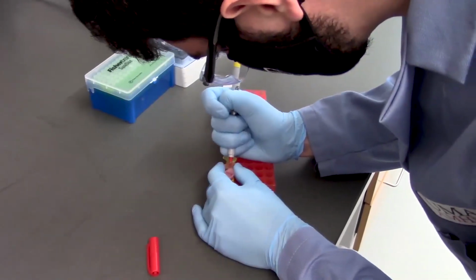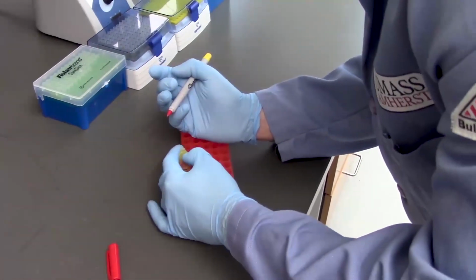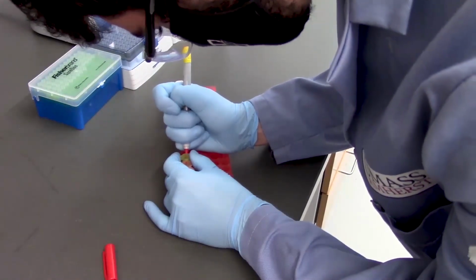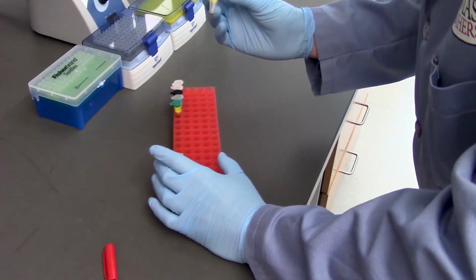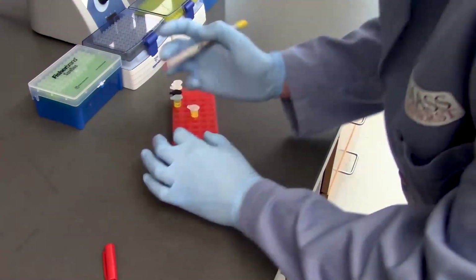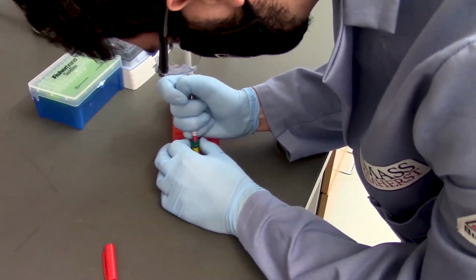Start by preparing a buffered solution of your protein of interest at a concentration in the range of tens of micromolar. We commonly use a 10 millimolar pH 7.4 MOPS buffer. Alternatively, an existing protein solution may be buffer exchanged into MOPS or another buffer if the original sample contains a buffer that has nucleophilic functional groups. It's necessary that the buffer not have nucleophilic functional groups because they will interfere with the DEPC protein reaction.